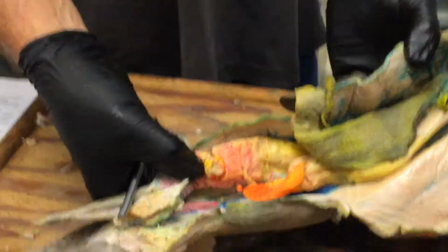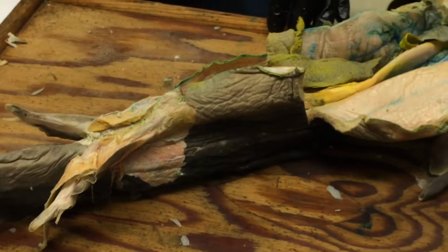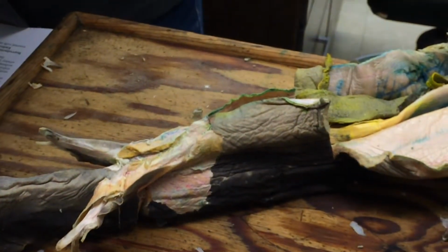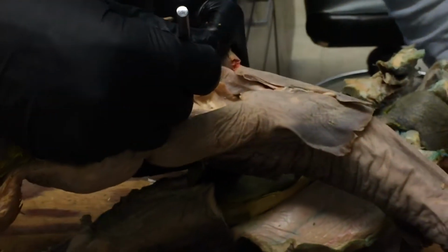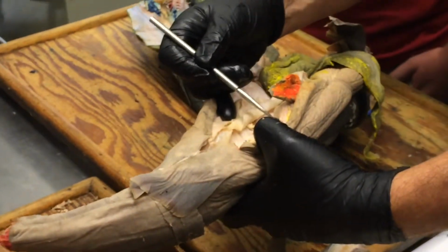Is there a difference between caudal? Is it post or just caudal ligament? Caudal ligament. Okay. Yeah, there's no post. The shiny one. That's the shiny one. Let's see if we can see this female. Sometimes they show up more easily on the females because they don't have the archinephric duct. See this shiny thing running right down the middle? Okay, yes, that's right. Okay, so that's caudal ligament.